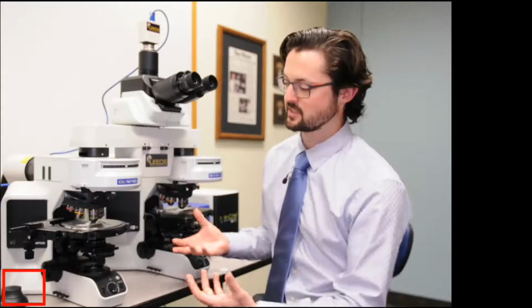So this is the LCT system. The idea of an LCT is that it's for trace evidence, and a really important part about it is color balance. One of the things that we've done on our comparison microscope is we've been really focused on light intensity and color balance out of the box. So when an examiner has everything set up in Kohler, it will be neutral between both sides.